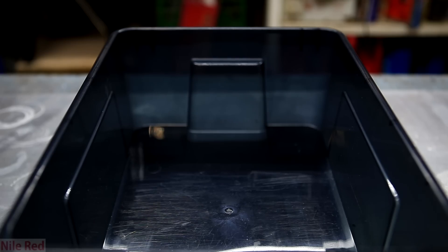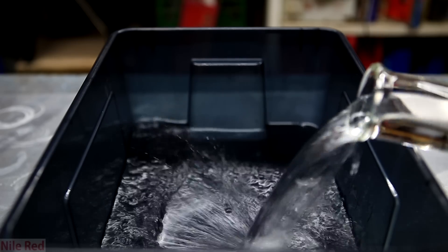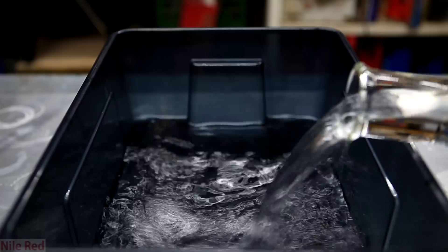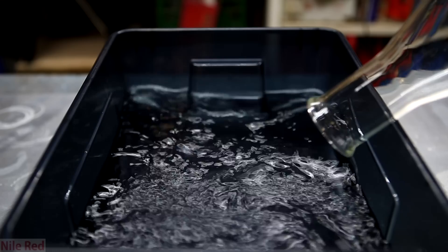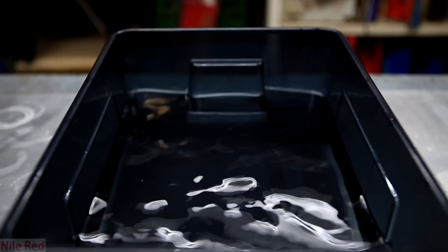A major problem that inevitably arises when you do chemistry is how do you clean your glassware? In general, using water or another solvent like acetone is enough, but what happens if it isn't and there's still residue left over?